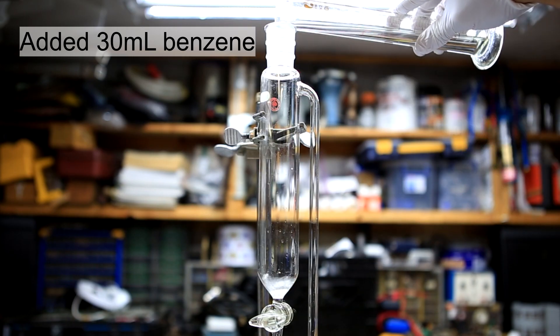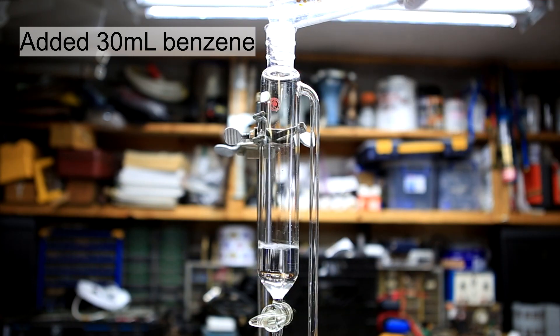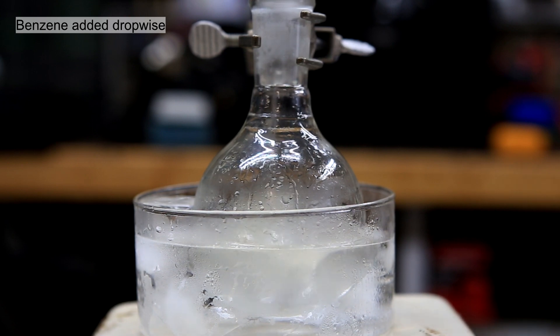To an addition funnel was added 30 milliliters of benzene. While the acid mixture was cooled in an ice bath, the benzene was added dropwise.